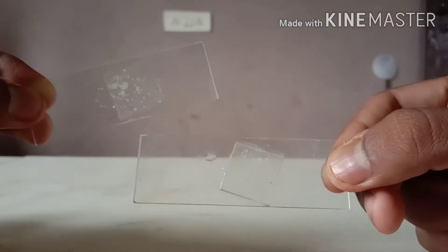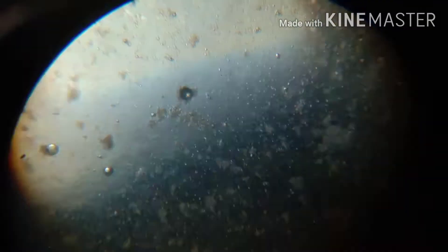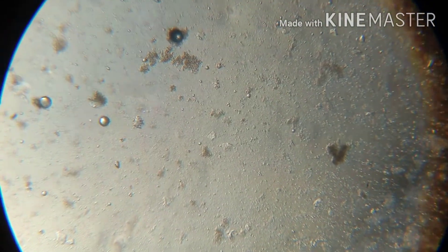In order to understand the difference, I'm putting the specimens under the microscope to see their structures. So at first, as you can see, this is the fresh curd — the first specimen. It's pretty clear, with not much visible content inside it.